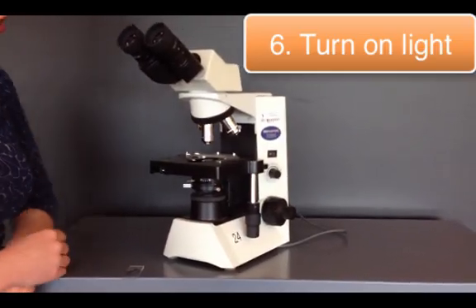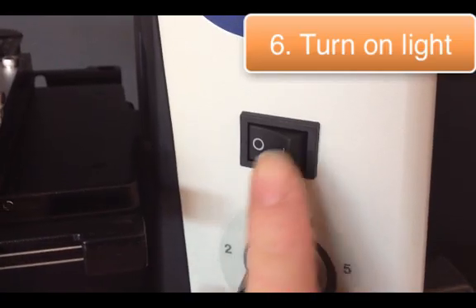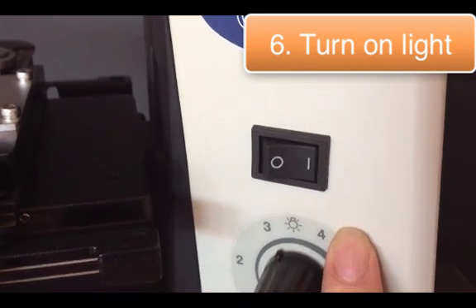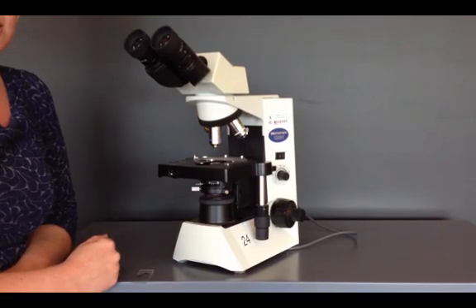Now you're ready to turn on your microscope. Go ahead and switch the power button so that the 1 is clicked on.